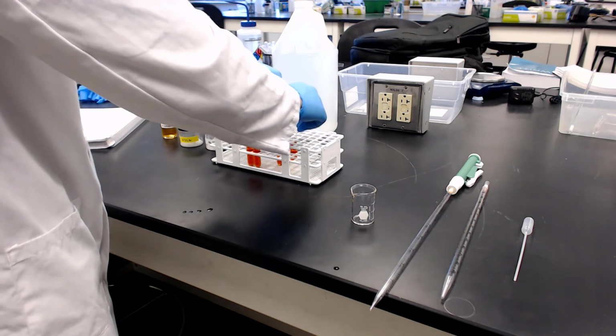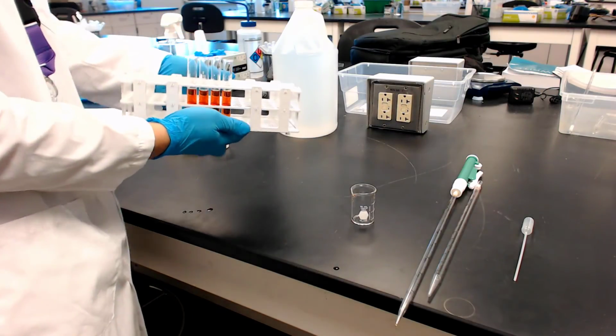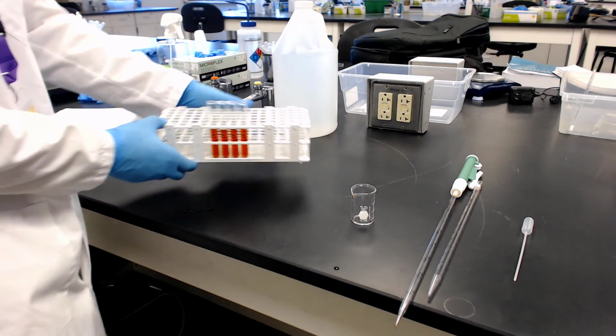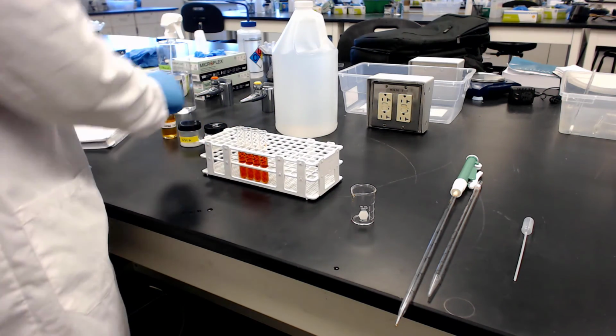Okay, so at this point, we are getting our 4 tubes ready. We are done with step 2, part A. Page 6, the 4 tubes are ready. Remember, we're going to keep one intact. That tube is going to be unchanged. That's going to be our reference color. So now we're ready to go to step 3.